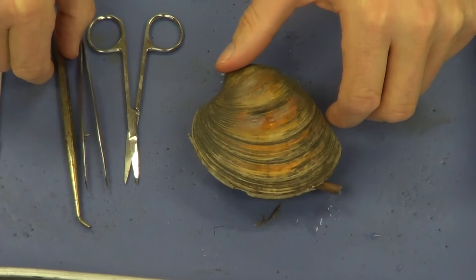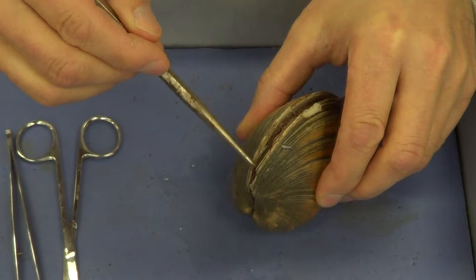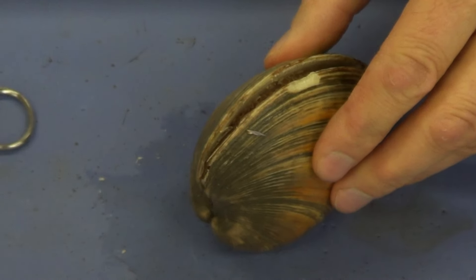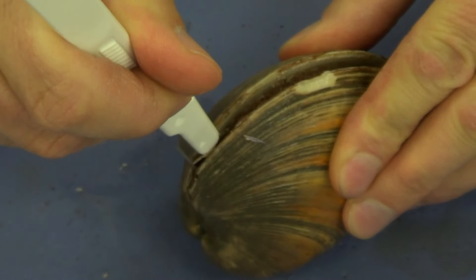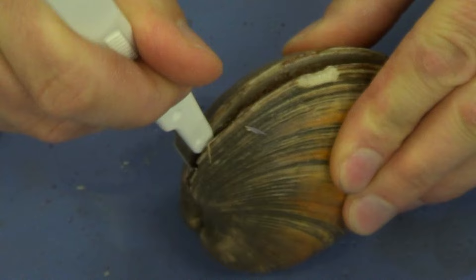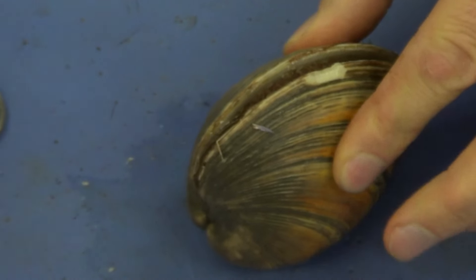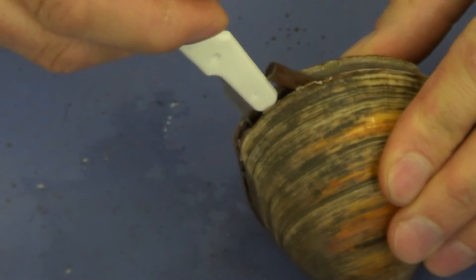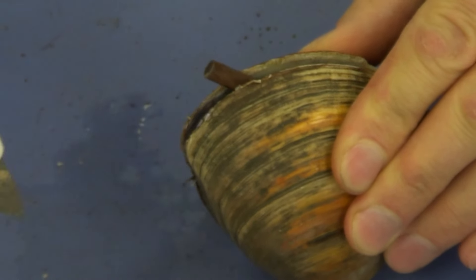So let's go ahead and cut those adductor muscles. I'm going to go to the ventral side and off to the side — I can see one right here, and I can feel it with the probe. I'm going to go ahead and cut that. Be very careful here because you may not be able to cut the entire adductor muscle, but get in there and cut what you can. Make sure to keep the scalpel directed away from you. Go to the other side and do the same thing — find the adductor muscle and begin to cut it.